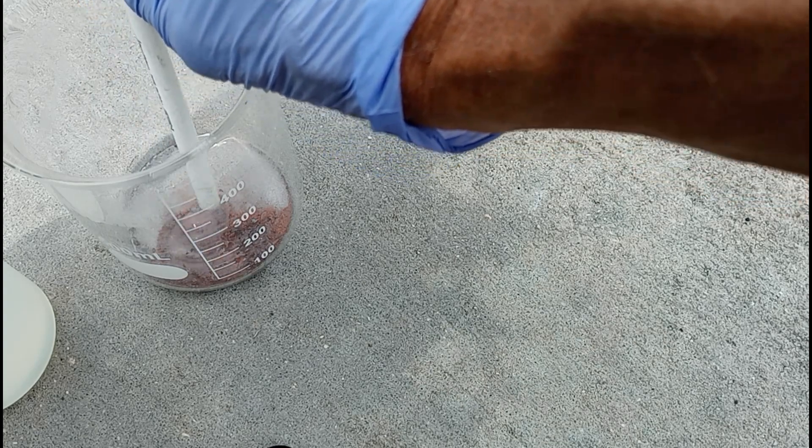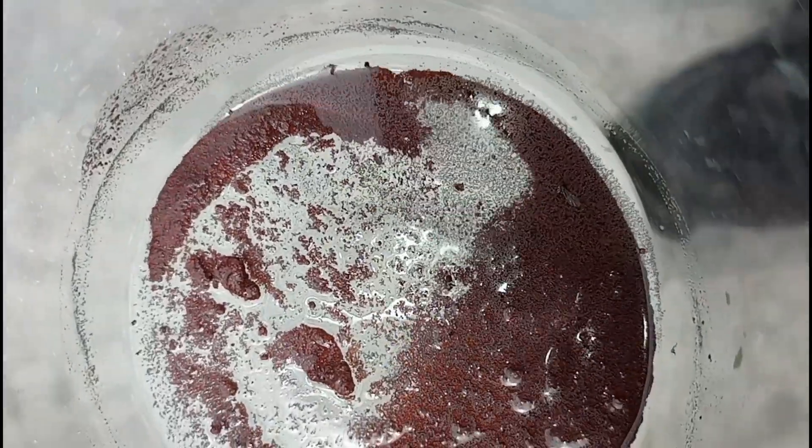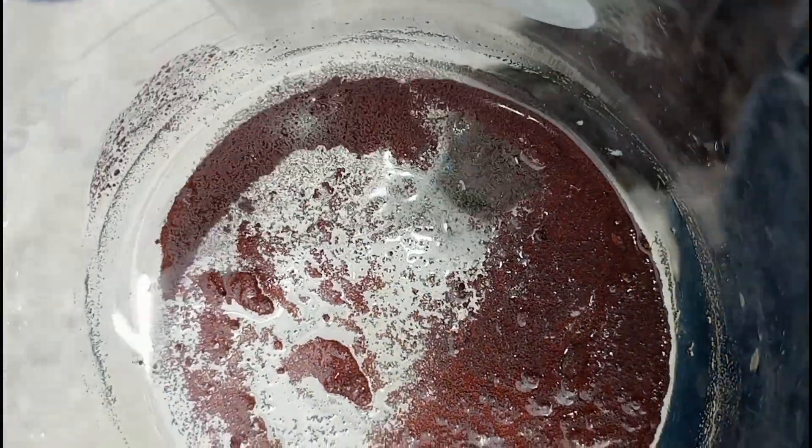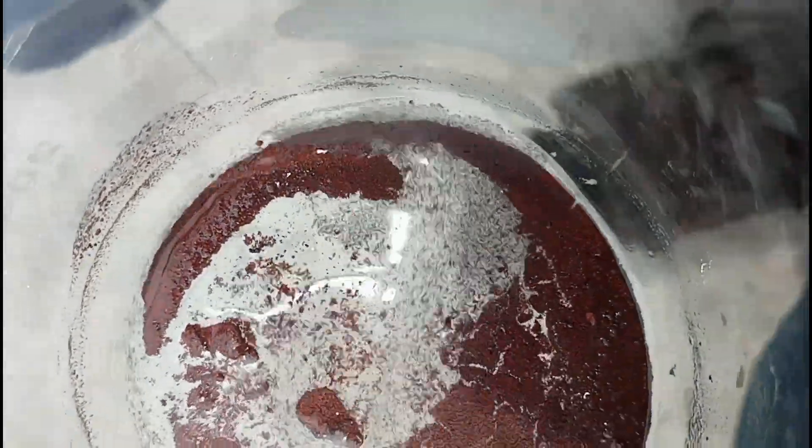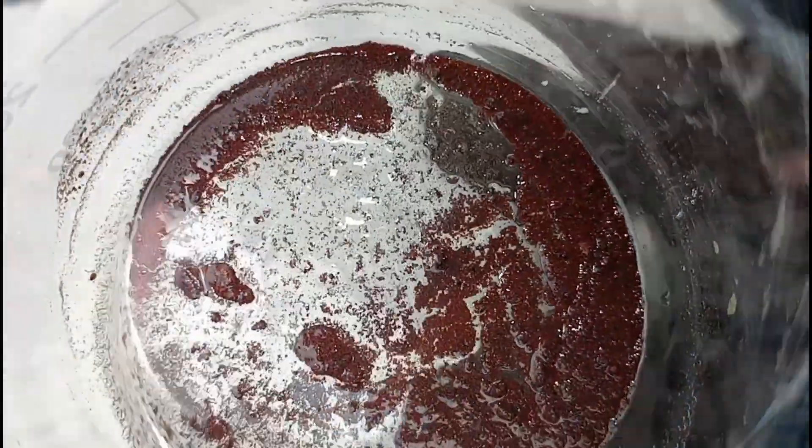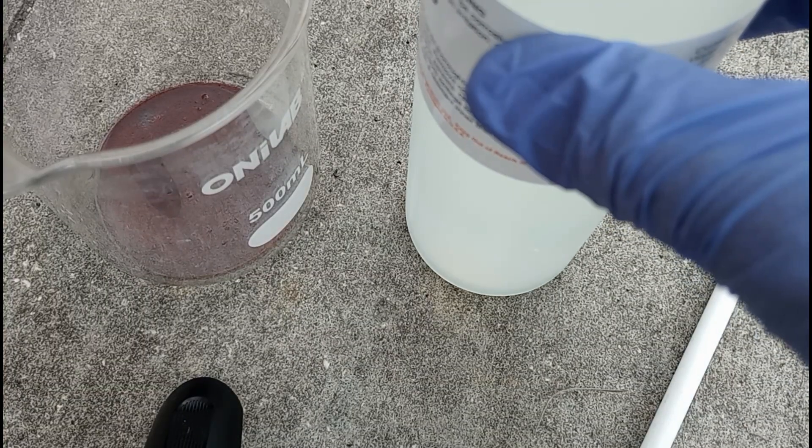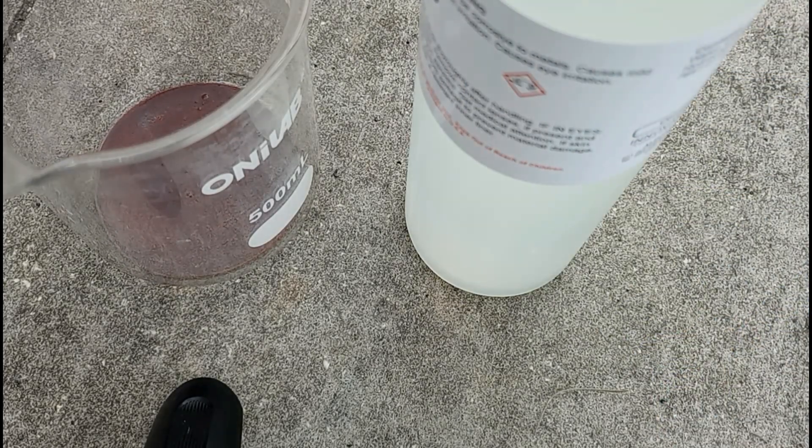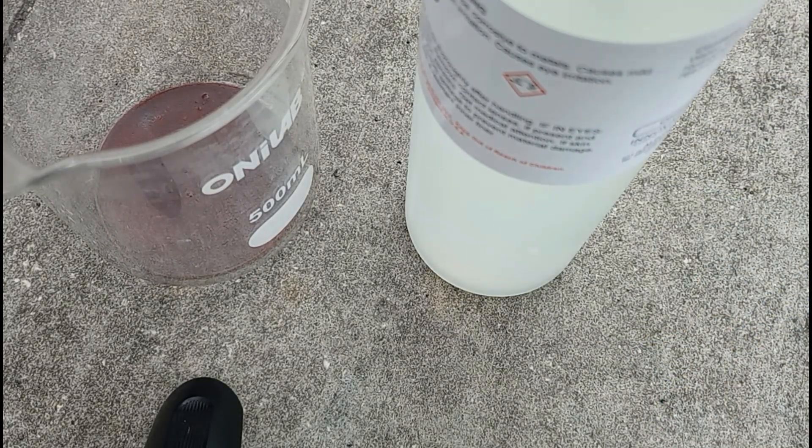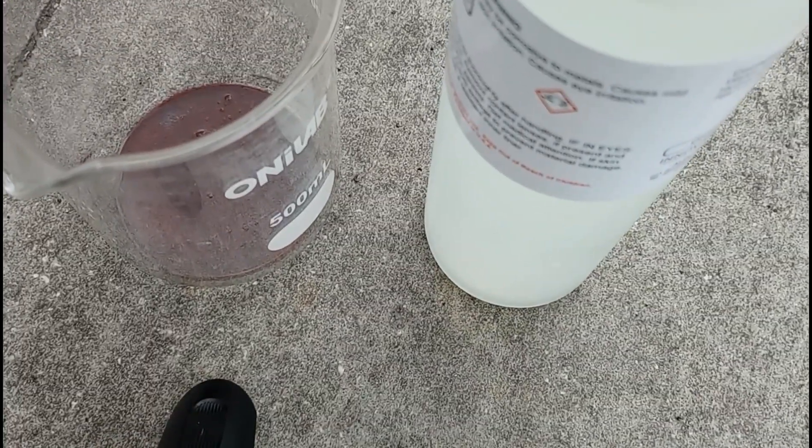Initially, there's no really obvious reaction. You could see something happening in there, but it wouldn't even show up on film. It was so small, and there's no bubbles to indicate that anything's getting dissolved. So we added just a little bit more, and since there wasn't much happening, I wanted to test the hydrochloric acid, since I just opened this bottle.